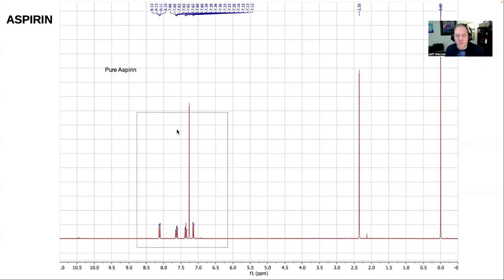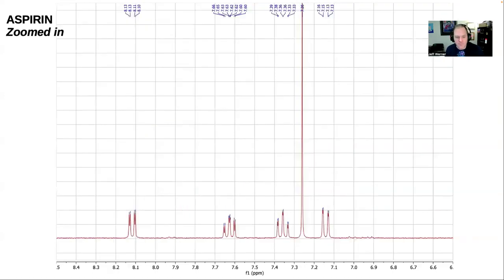So I'm going to zoom in on this cluster on the left, which is what we call downfield. Notice that the scale goes backwards. It starts from 0 on the right and counts up. We're looking at this region that goes from about 6.5 to 8.5. When we look at this region, we get this fingerprint or pattern associated with aspirin. Which of these peaks corresponds with which hydrogens in the molecule is beyond what we're talking about today. Just notice that we have this one really big peak. It's what we call a singlet. It's one peak, not split into multiple little peaks. It's just one single peak at 7.25.